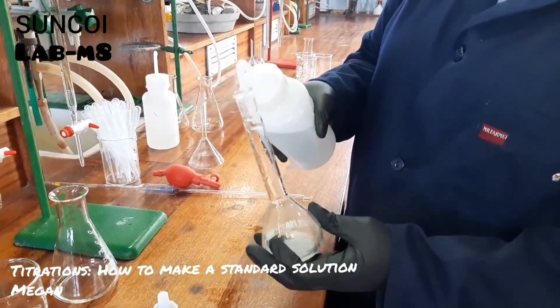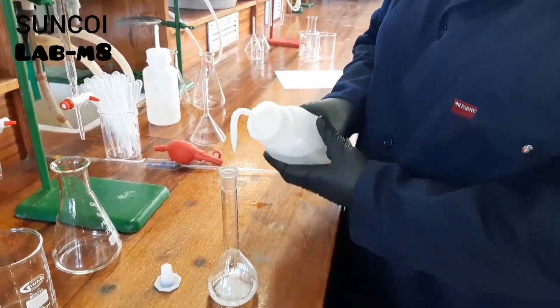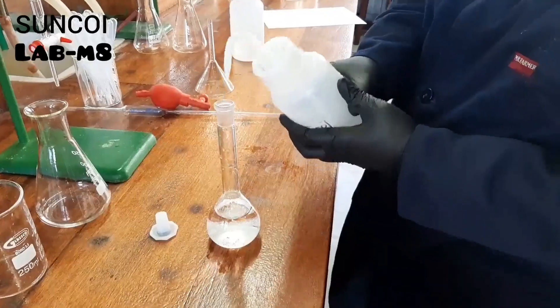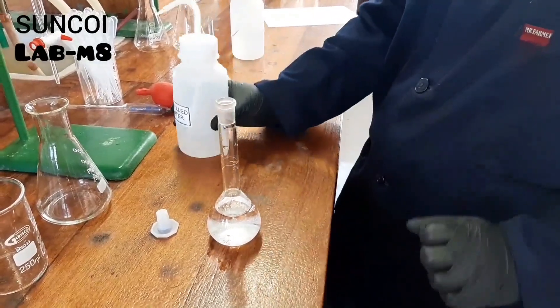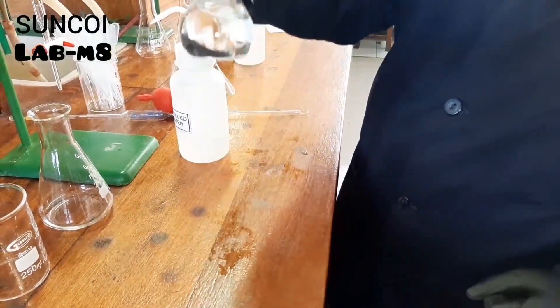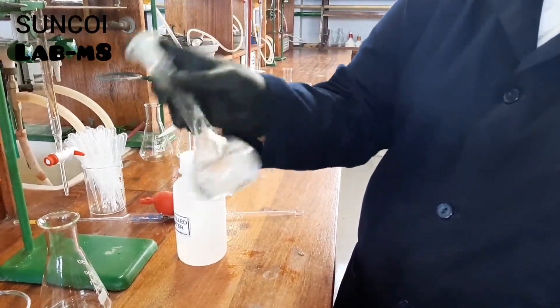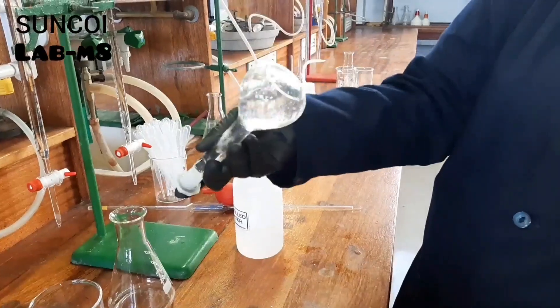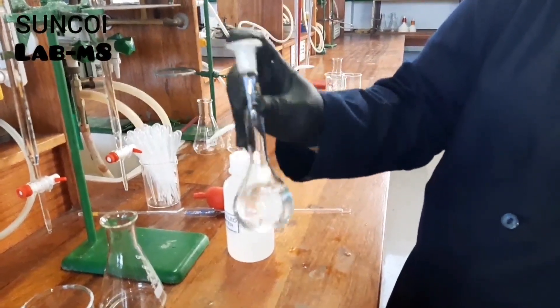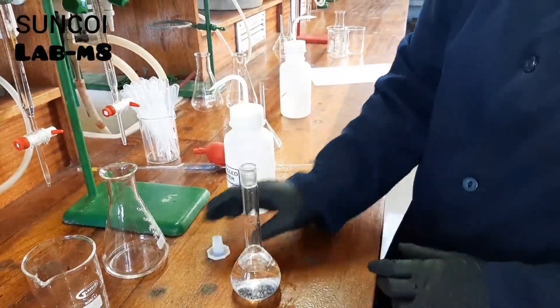We are now adding our water. You're going to try and add a bit more than half of your water so that you are able to shake your solution and everything can get dissolved very well. Then, once everything is dissolved, you can continue to add your water to the mark.